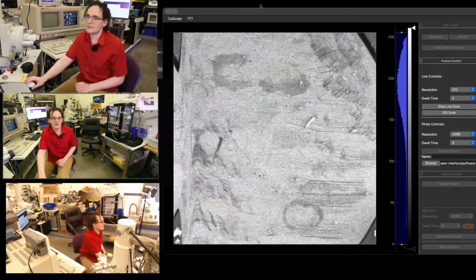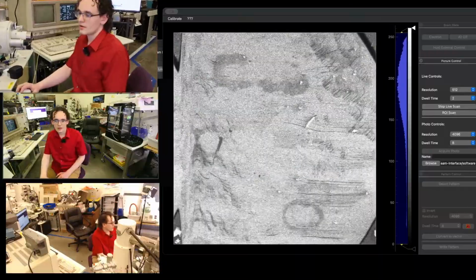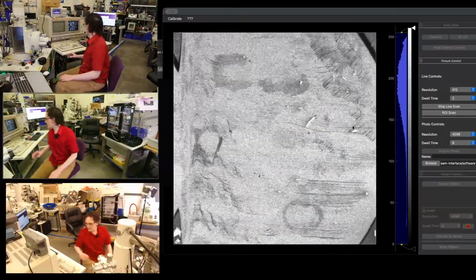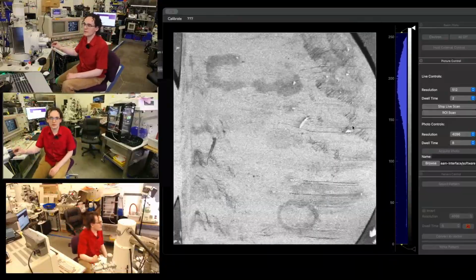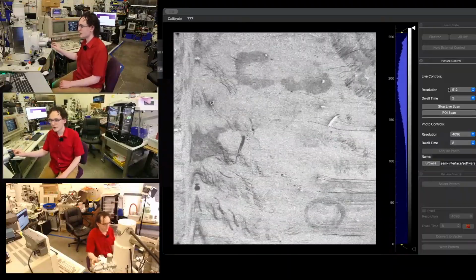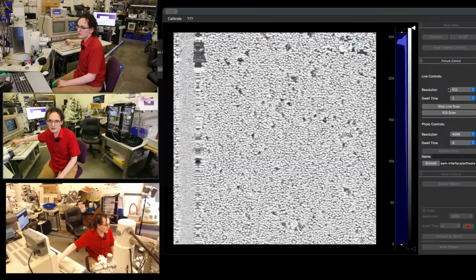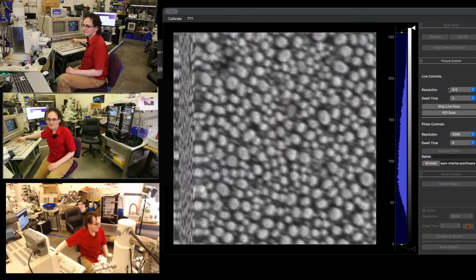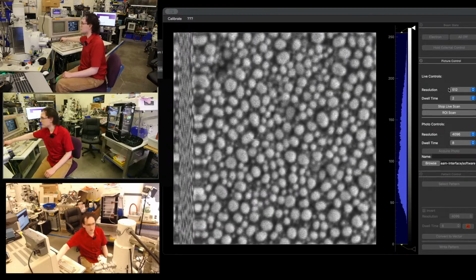So if anybody's got any questions, now's a great time to throw them in the chat. We'll do a little bit more just moving around and imaging with the OBI, and then we will move on to our sample preparation. So we've got a calibration target in here right now. This is a tin on carbon target at the moment. Do some stigmation.